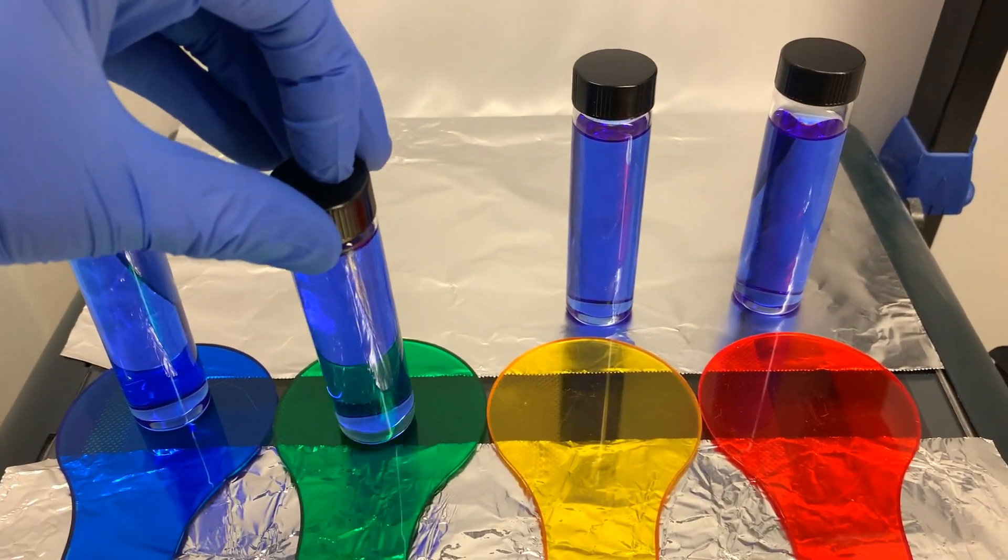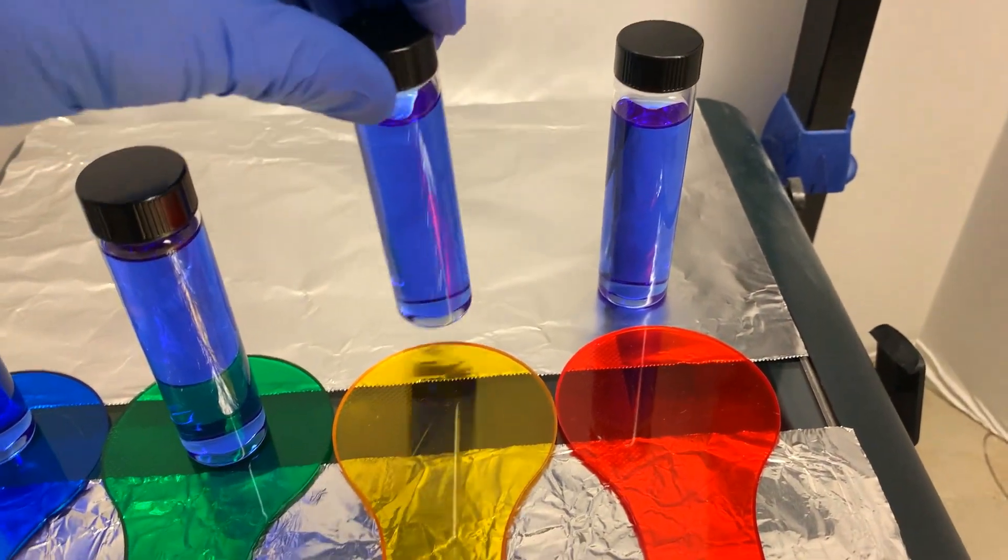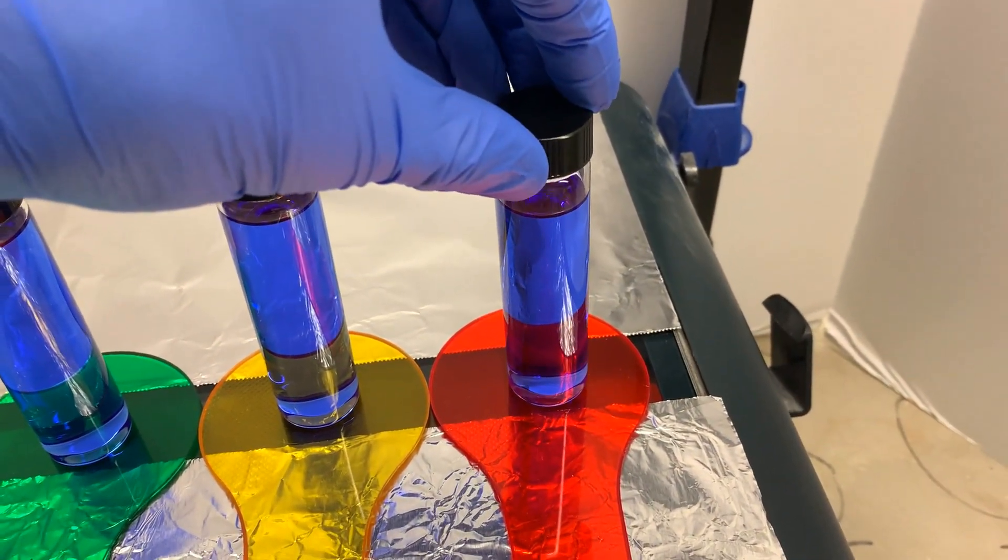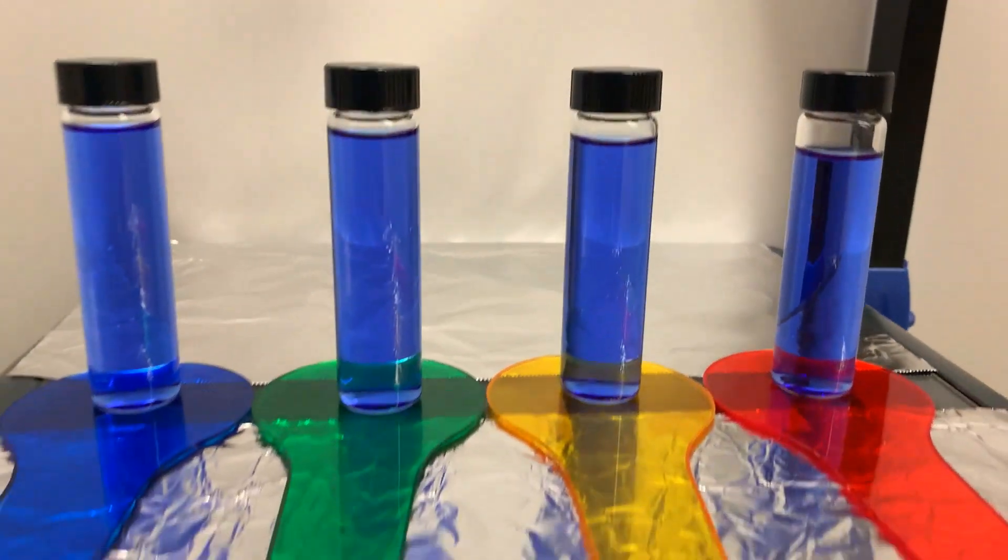To test this, I set up four vials containing thionine and iron ions. I set each vial on top of a filter that allowed only a certain color of light to pass through it.